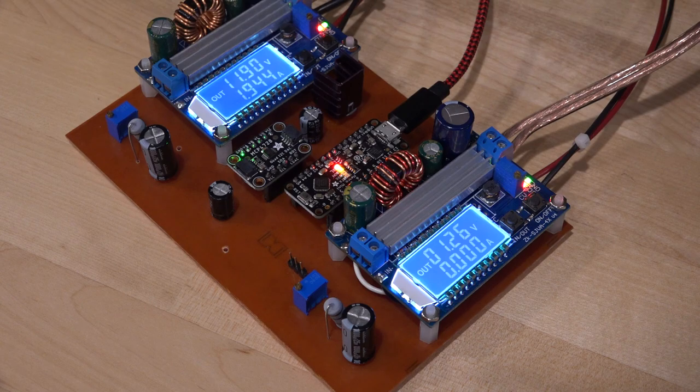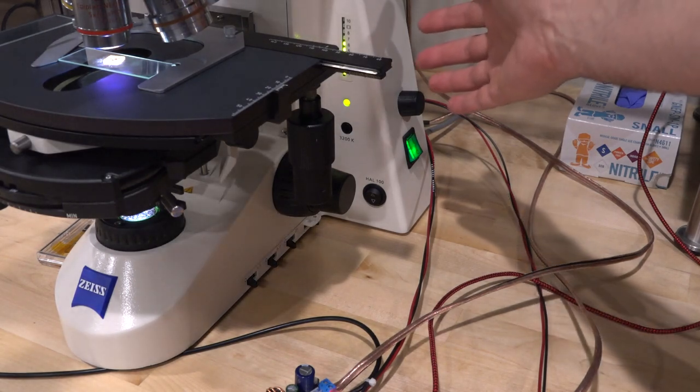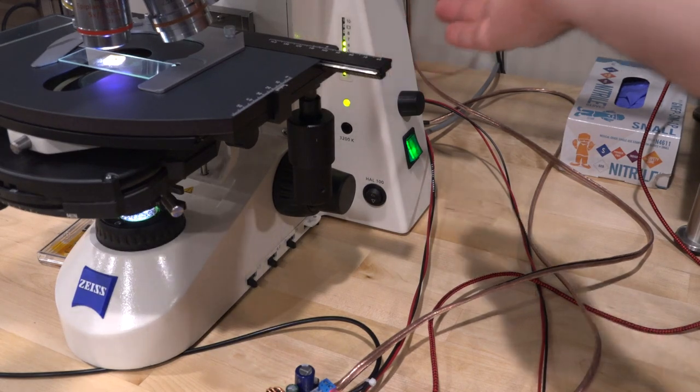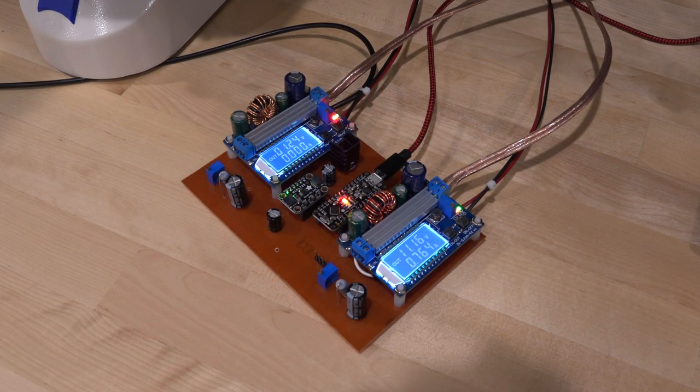So now the top LED is being driven. And I can just do this back and forth without any issues like so. And this is, again, very convenient because whenever you change a lens on this microscope or you move any of the objectives around, it actually dims the light to protect your eyes. So that interconnection within the interactions of the lenses and different filters and the microscope's internal light is pretty important to preserve because it's a crucial part of its operation.